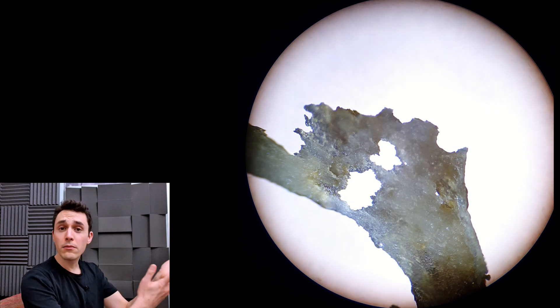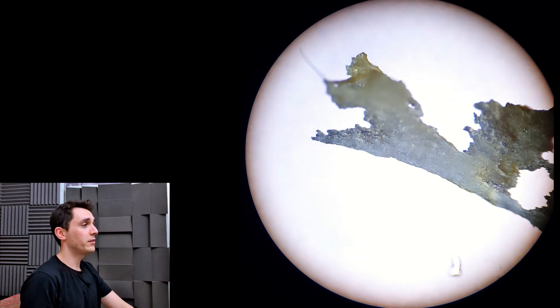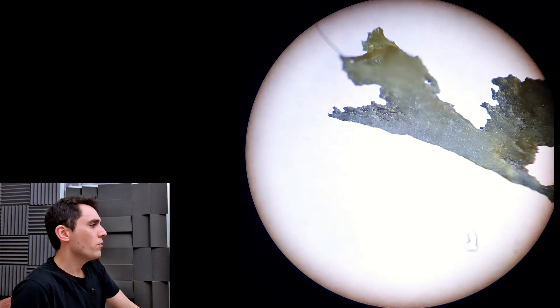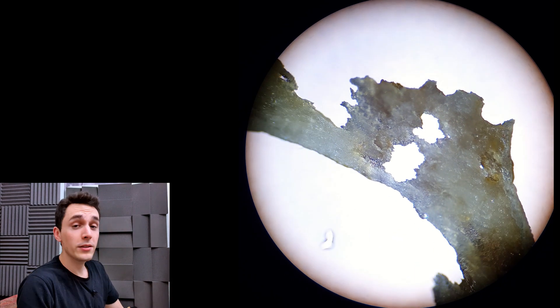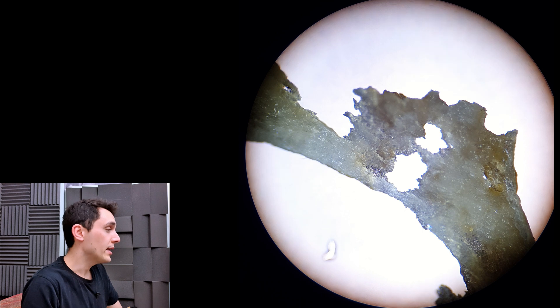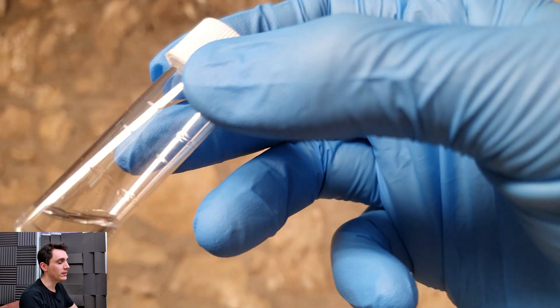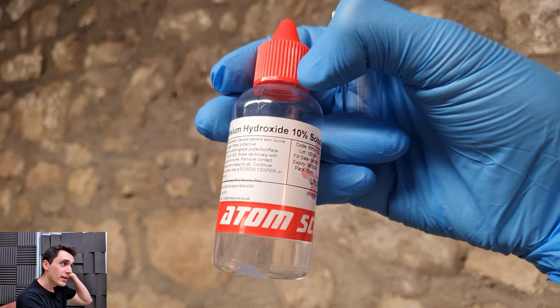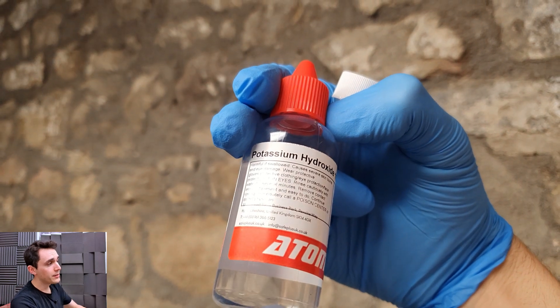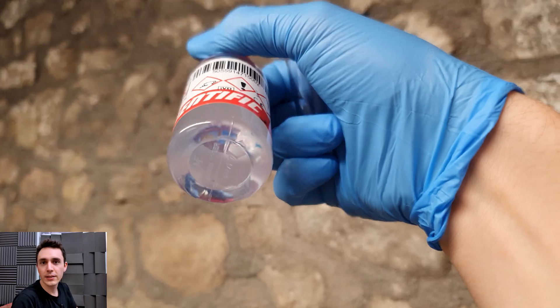As you can see it looks unusual, but it could be dead skin, and that's what we wanted to verify. So what we decided to do was immerse this little piece of bone in potassium hydroxide or KOH — K being the chemical sign for potassium and OH is the hydroxyl group — at 10%.